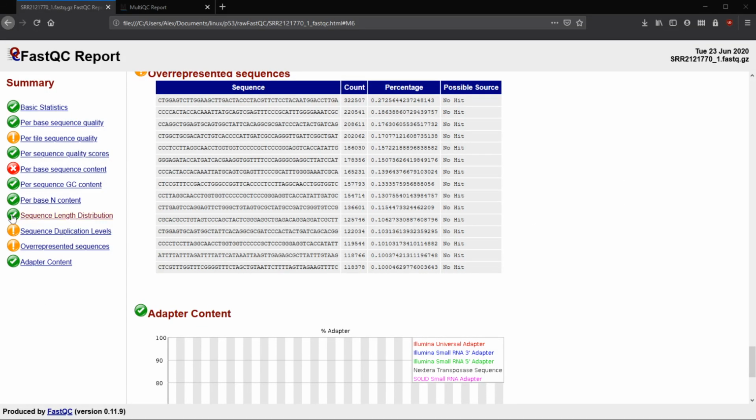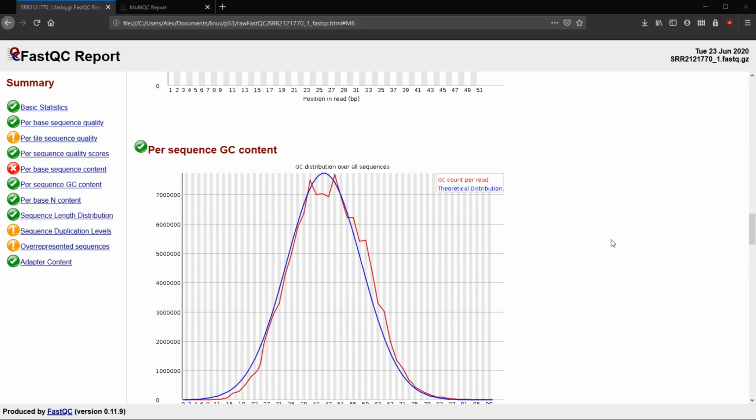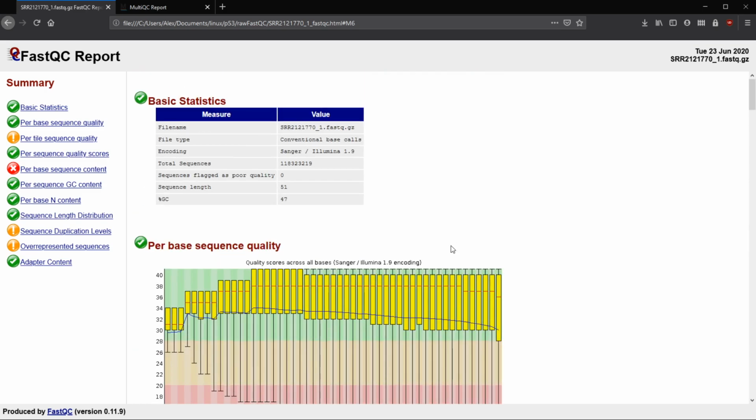All right, hi everybody. So I realized that last time we created the FastQC report, but we never actually talked about what some of this stuff means. So I figured go ahead and talk about it today, and then next time we can run FastQC on the trimmed reads, which we have done now, along with MultiQC on the trimming files to find out some of the statistics for actually trimming, whereas the FastQC will just tell us about the new reads.